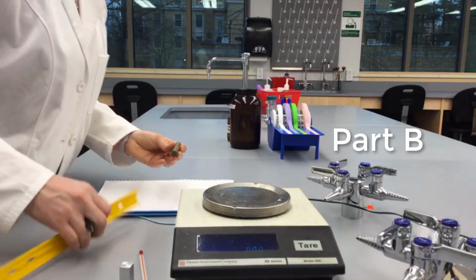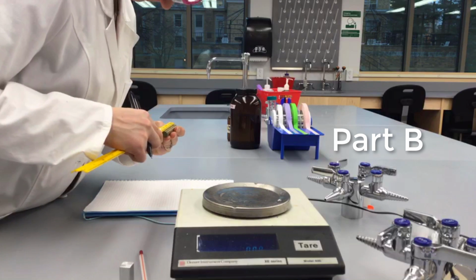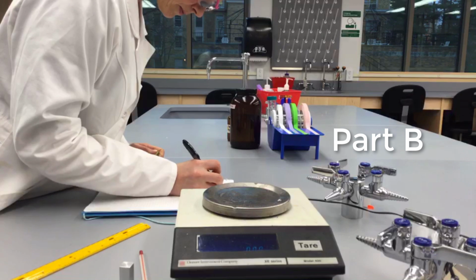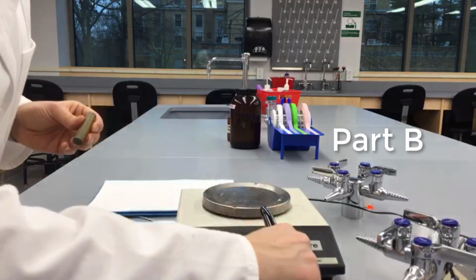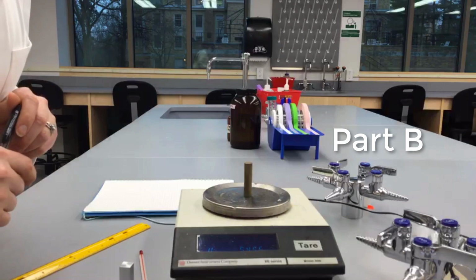You will do this experiment using a cylindrical bar and a rectangular bar made of different metals. Measure the dimensions of each bar and use simple math to calculate the volume of each bar. You will use the volume as well as each bar's mass in order to determine its density.